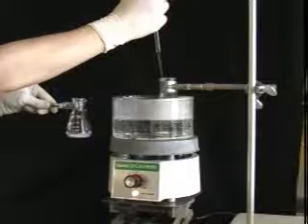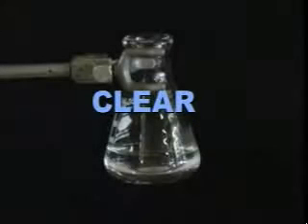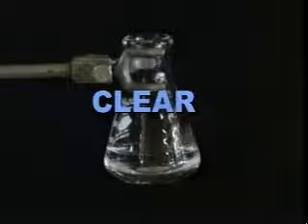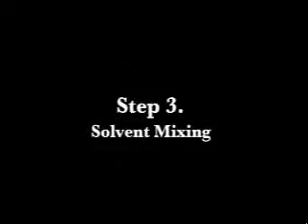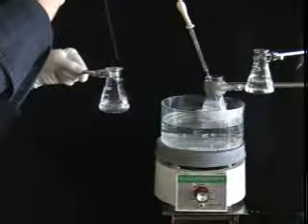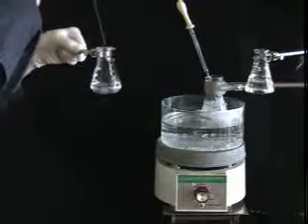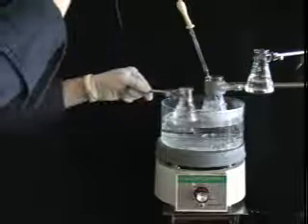As before, dissolve your sample in the minimal amount of hot solvent, in this case solvent 1, acetone. Add just enough hot solvent to obtain a clear solution. Then add solvent 2, in this case water, dropwise, until the solution turns cloudy. Swirl and heat the solution to make sure that the cloudiness persists.